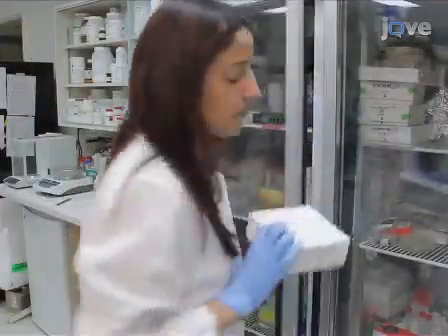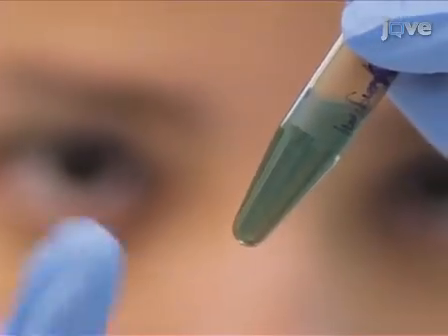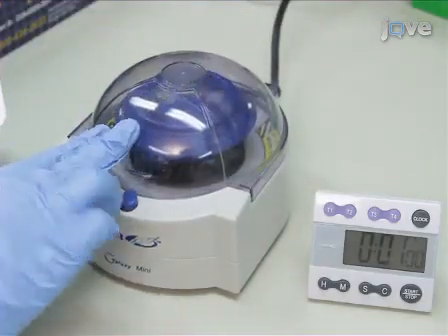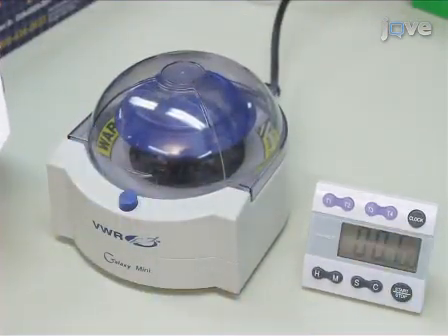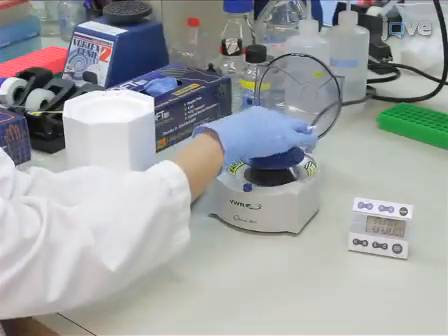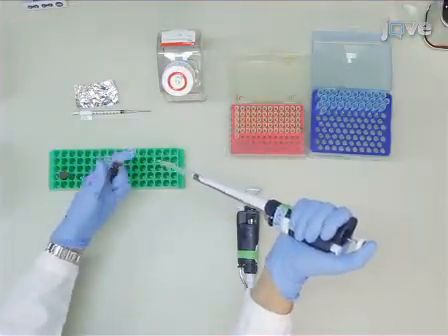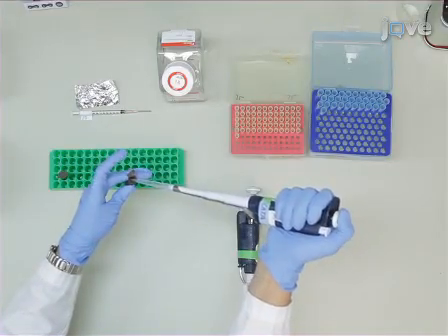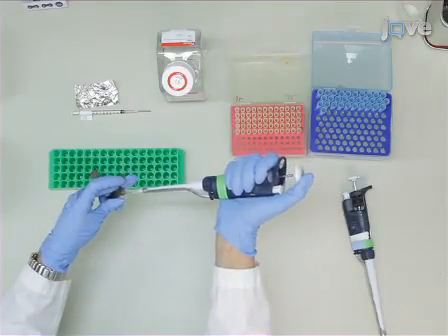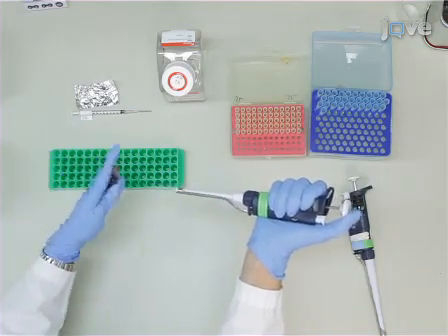Nanoparticles must be labeled with a fluorescent dye compatible with the intravital microscope and stored at 4 degrees Celsius in PBS, where they are stable for at least 1 year. Then, spin down the nanoparticles for 1 minute to pellet any aggregates before being drawn into the microinjector. Now, using PBS to dilute the nanoparticles, prepare a working concentration of 1 mg per milliliter to ultimately inject 50 micrograms of nanoparticles in a volume of 50 microliters. Now proceed with injections.